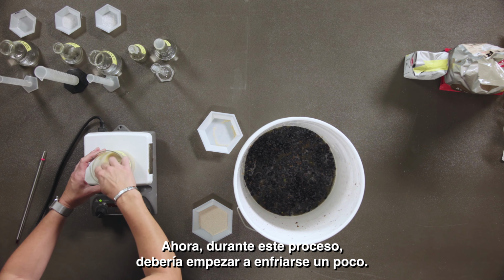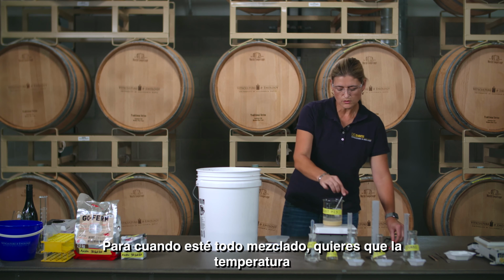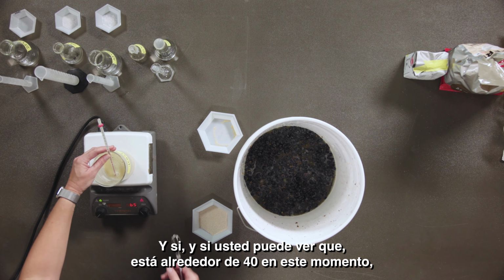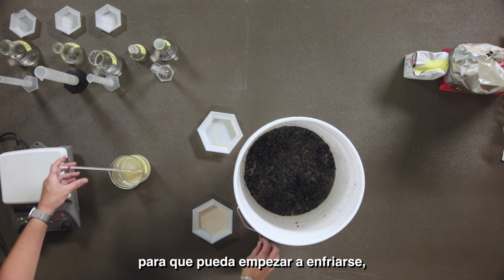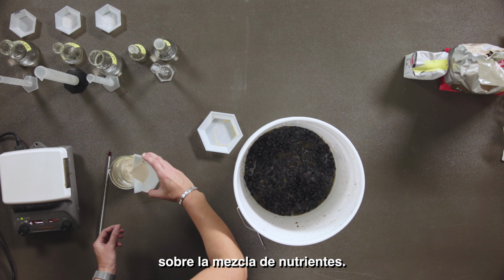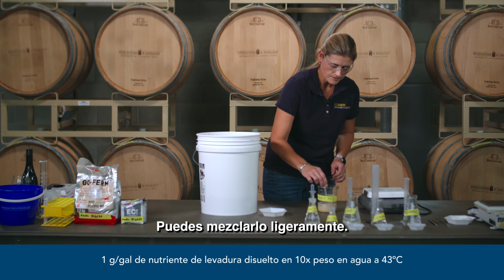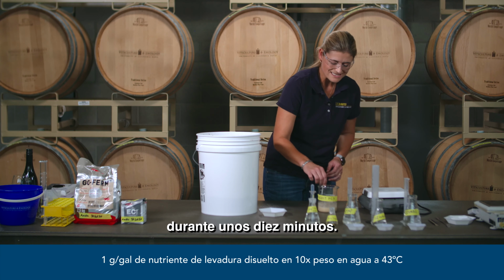Now during this process, it should start cooling down a little bit. By the time you have it all mixed in, you want your water temperature to drop down to about 104 degrees Fahrenheit. And if you can see that, that's just about 40 at the moment, and I'm going to remove it from the heating plate so it can start cooling down. Then you sprinkle your yeast above the nutrient mixture. You can mix it in lightly, and then that needs to stand and rehydrate for about 10 minutes.